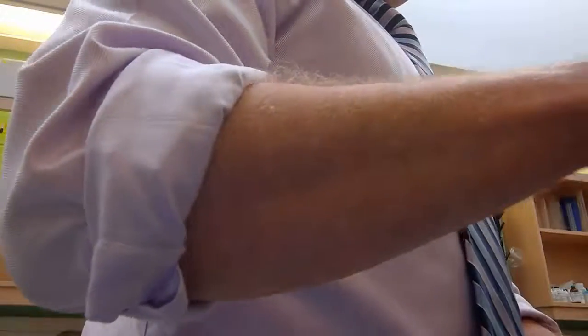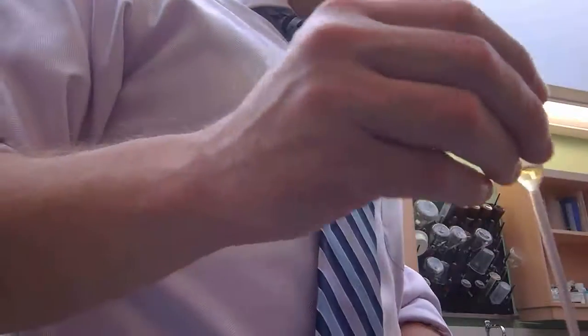Glucose is a polysaccharide? It's a monosaccharide. So we're going to do this polysaccharide test on it using iodine, but what are you betting? You're probably betting there's no change, right? Your hypothesis would be, in those 2 experiments, that you get what? Tell me what you're hypothesizing you would get for the iodine test, which tests for polysaccharides, Jack.